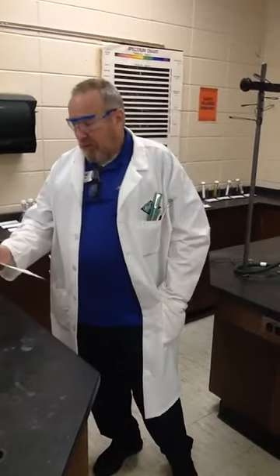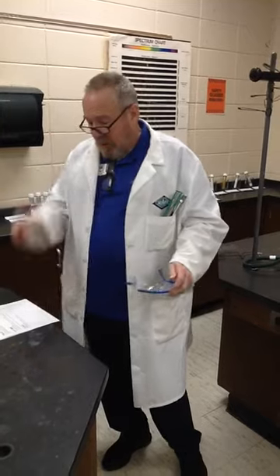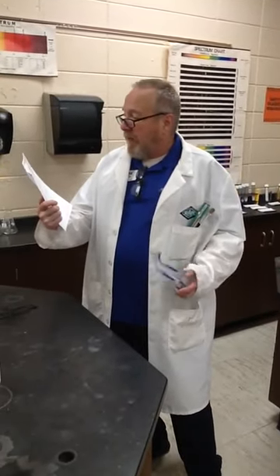So, this experiment is called Chemical Names and Formulas, and it says, very simply, wear your safety goggles, don't chew gum, drink, or eat in the laboratory, and never taste a chemical in the laboratory. I'll have some comments about that.